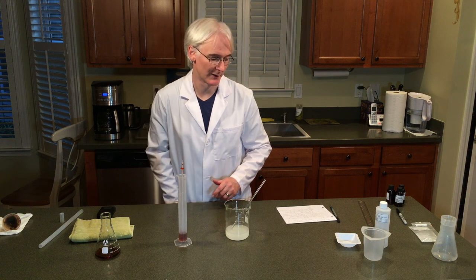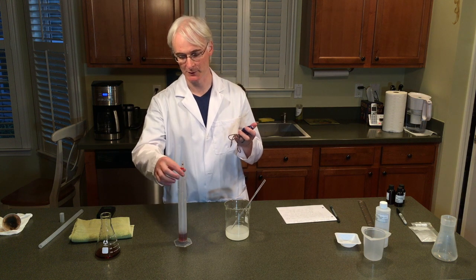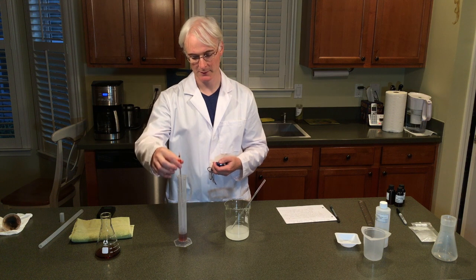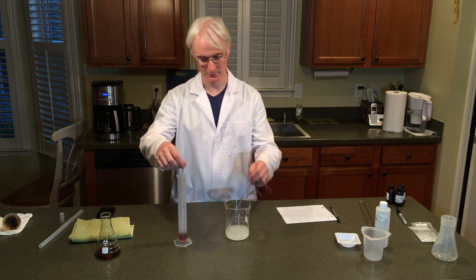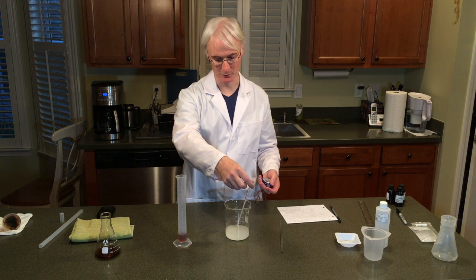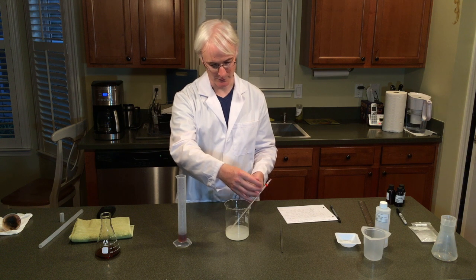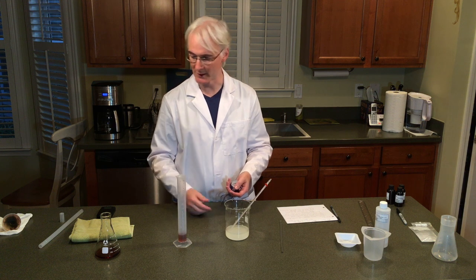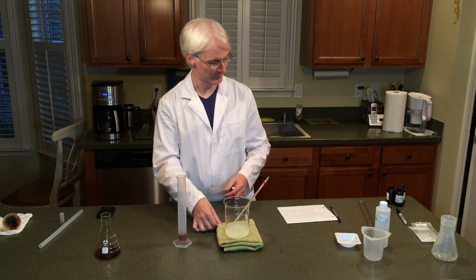We're going to be putting this 15 milliliters of iron 2 acetate into our cream of tartar and hydrogen peroxide solution, and we're going to have to time it. Have your timer ready — as soon as you pour it in, we know what time zero is, which is the current temperature reading of the iron 2 acetate. Remove the stirrer and the thermometer. About every 10 seconds for around 2 minutes, we're going to take a reading of the temperature. It should rise significantly. I'm going to put a towel underneath in case your surface is delicate.